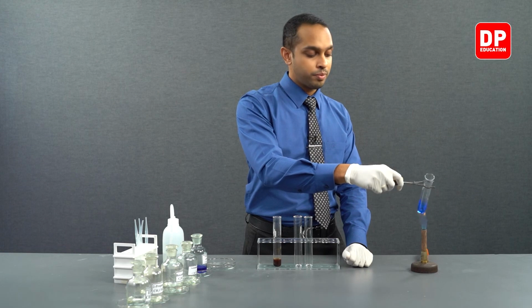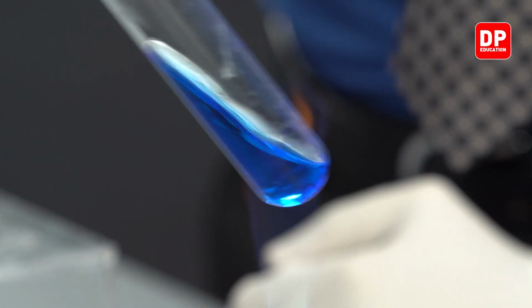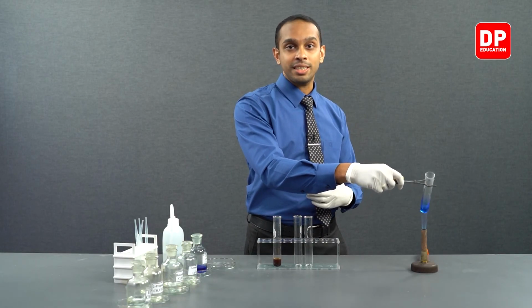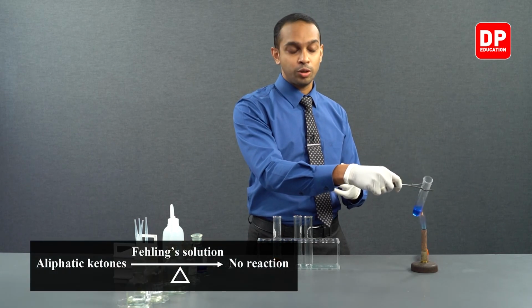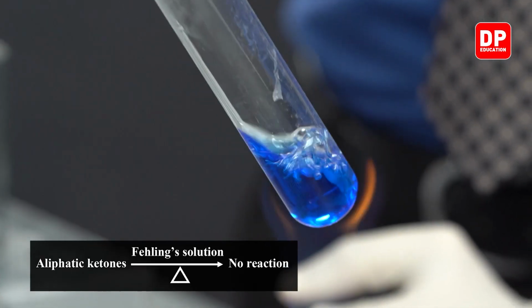As you can see, upon heating it, we are not seeing any change. This is because the ketones cannot oxidize into carboxylic acids. Aliphatic ketones cannot oxidize into carboxylic acids in the presence of an oxidizing agent like Fehling's solution.